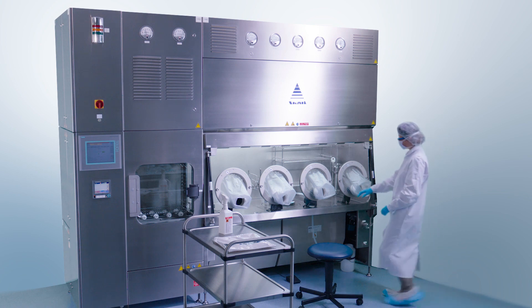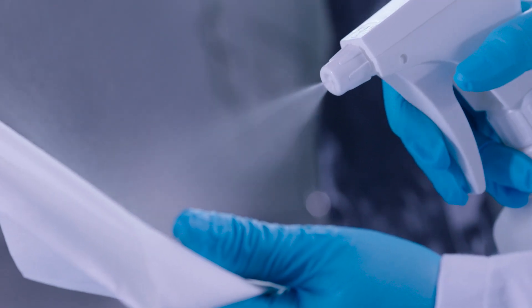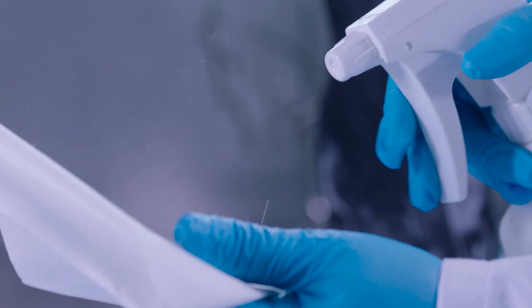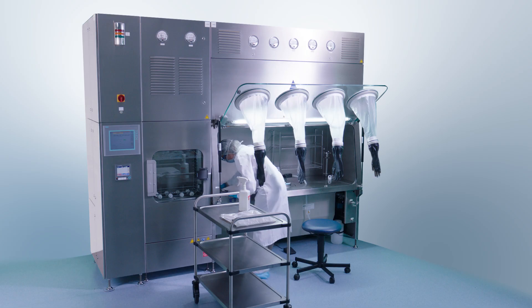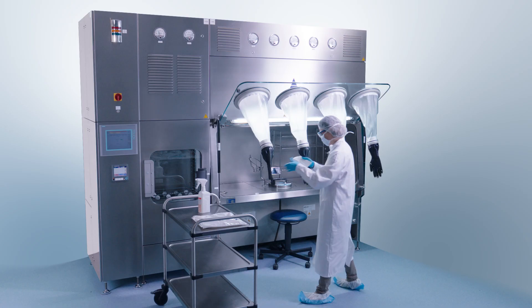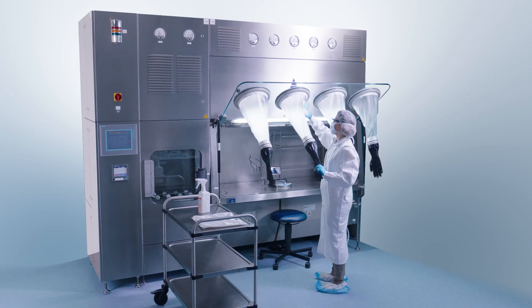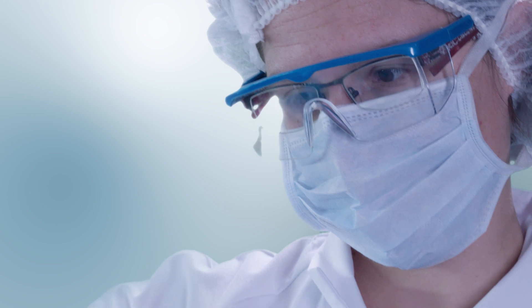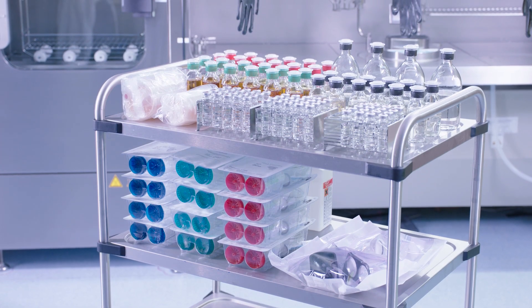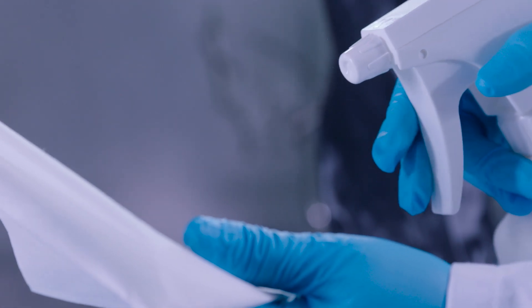Appropriate gowning procedures must be followed, regardless of whether the isolator is located in a classified area or not. After cleaning with a detergent and disinfection, the isolator chamber is ready to be loaded. All samples and materials are cleaned and disinfected.